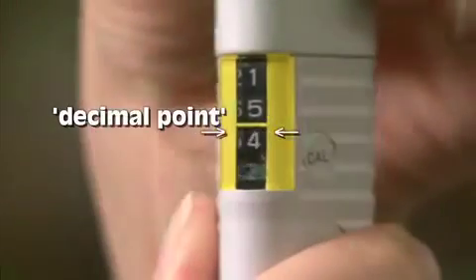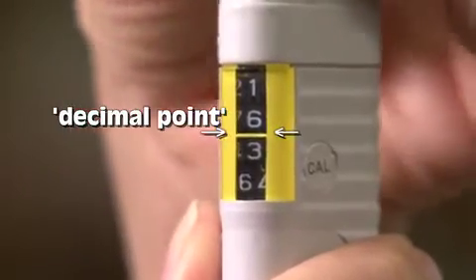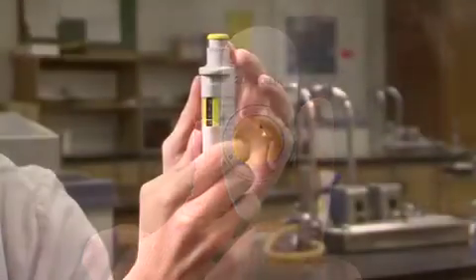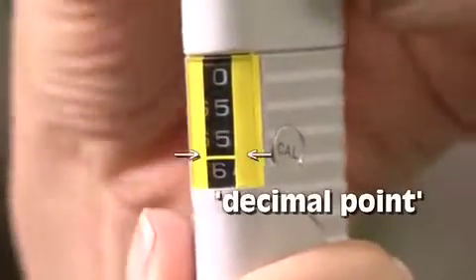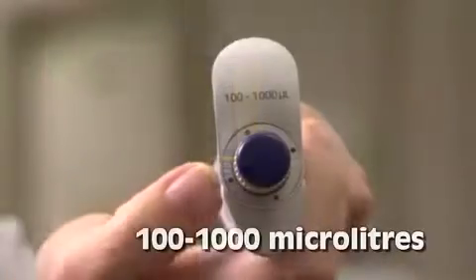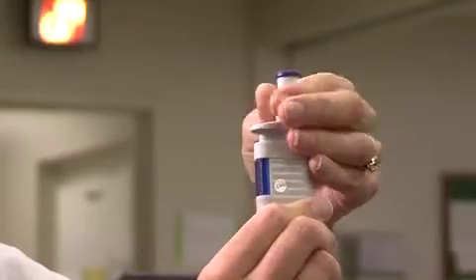For this P20, the top two digits represent whole microliters, while the last two are for the decimal values. For the P200, you still only have four digits, but the first three are for whole microliters, while only the last one is for fractions of a microliter. For this P1000, all four digits represent whole microliters.